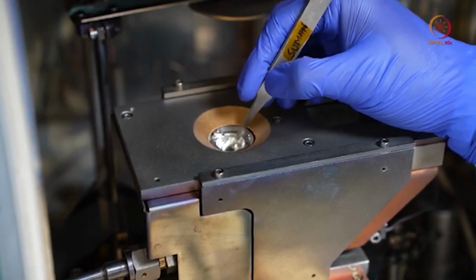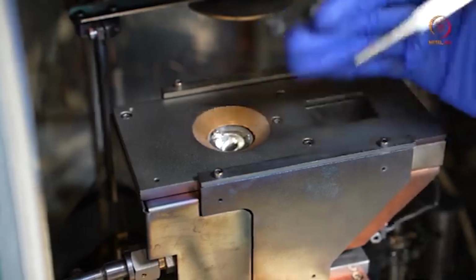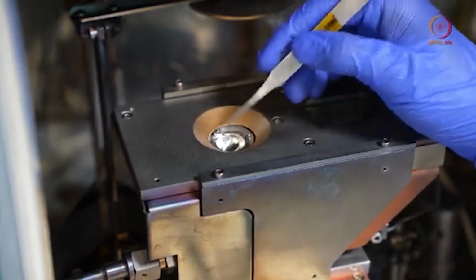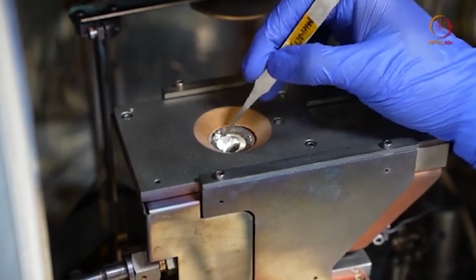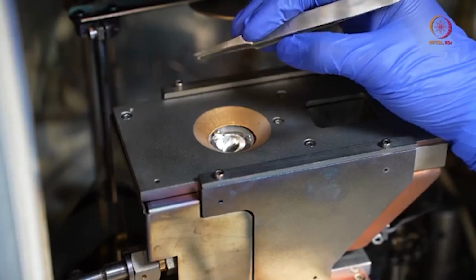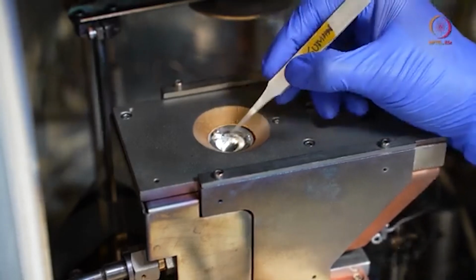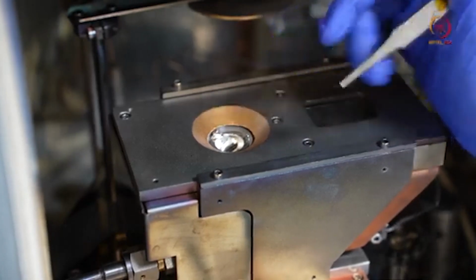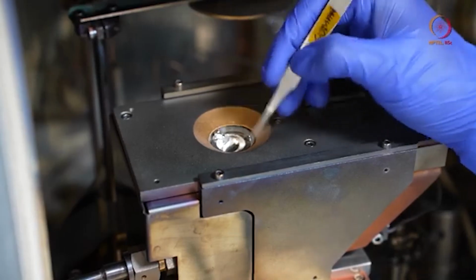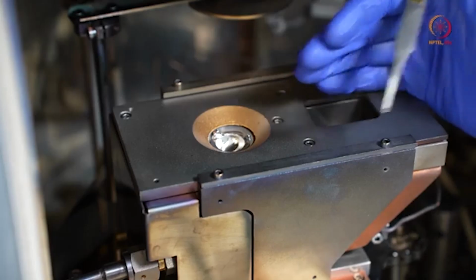When we started, aluminum, being the cheapest material, is what people usually use for testing purposes. Similarly we used aluminum, and it just spilled a little bit. These types of problems may occur because of either shifting of the beam or improper placement of the beam, or they may occur due to loading too much material.